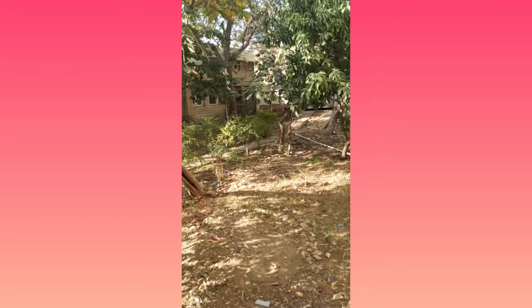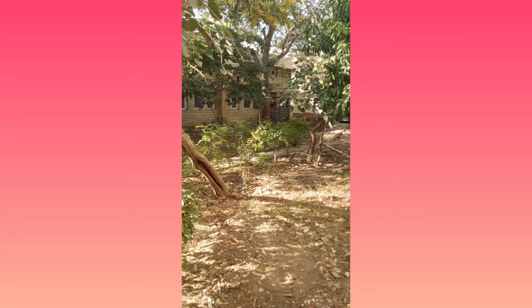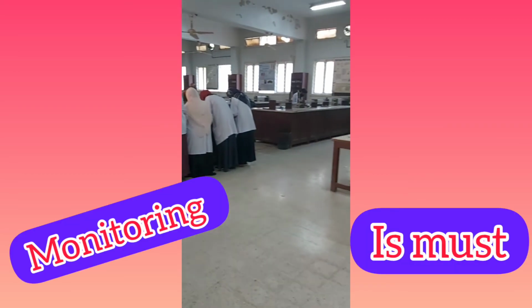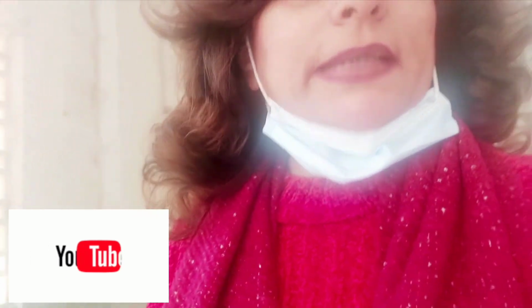This is where I'm standing right now, and this is my lab where my students are working, and I'm monitoring how they are working. So here they are. My students, hello and welcome to another video. Today my students have done the second part of the experiment, that is, detection of elements, and I have demonstrated it nicely, and now they are doing their work. You can see them working from here.